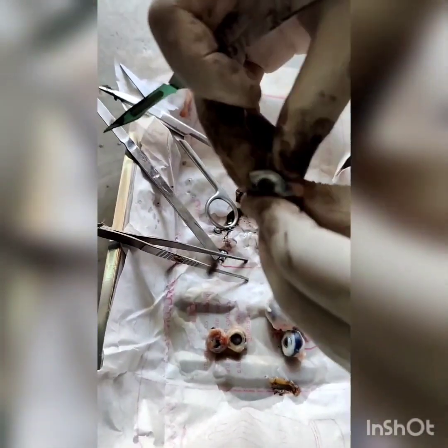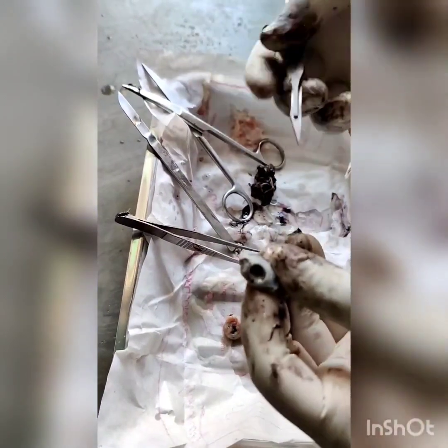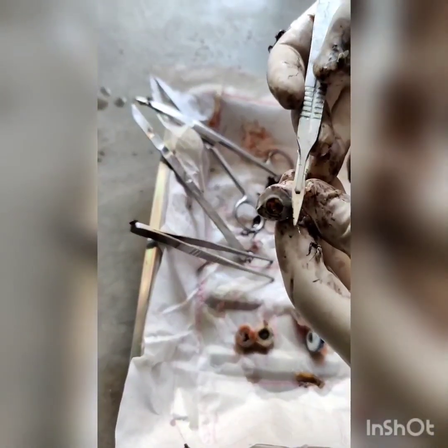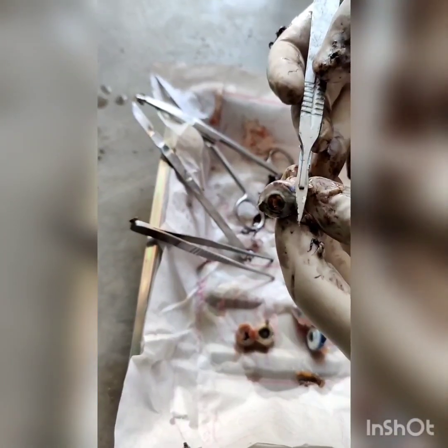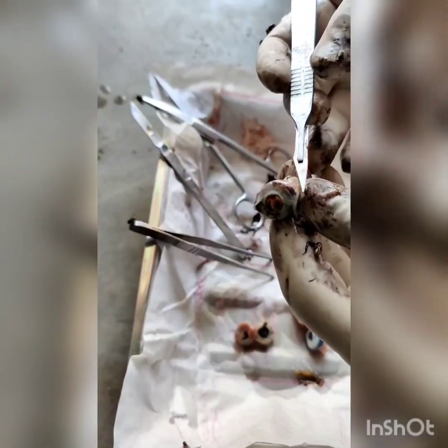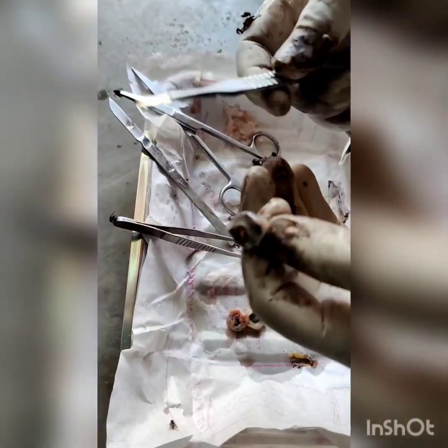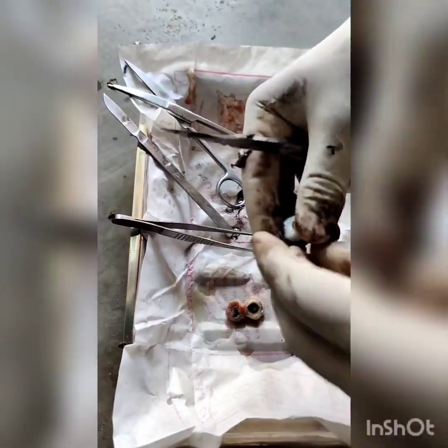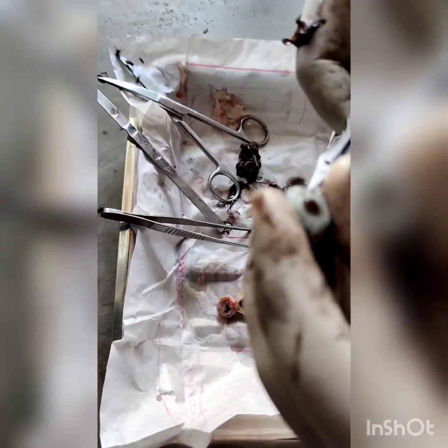At old age the lens becomes opaque and cataract occurs. If the intraocular pressure of the eye increases, that leads to glaucoma. These are the two basic diseases of the eye: cataract and glaucoma. Now the nictitating membrane is visible again.